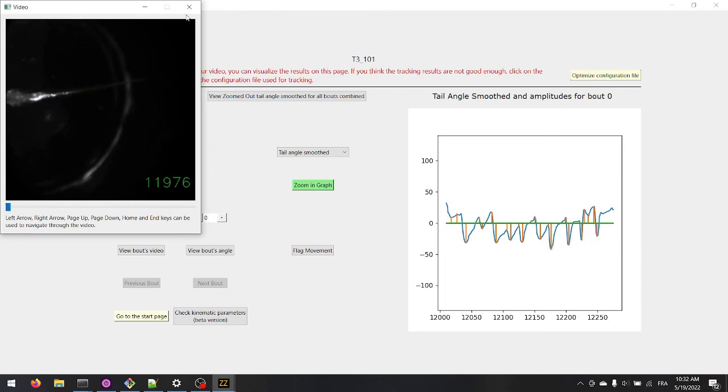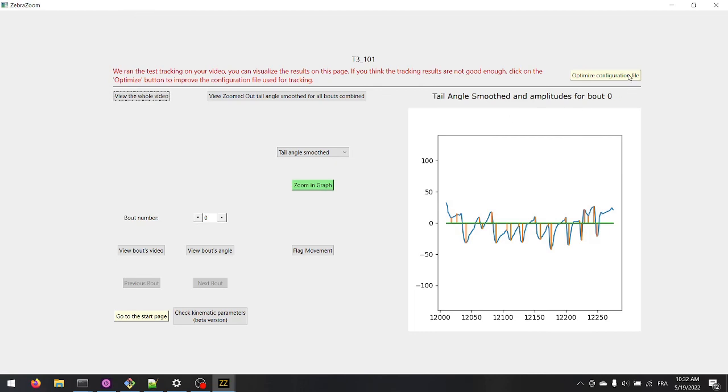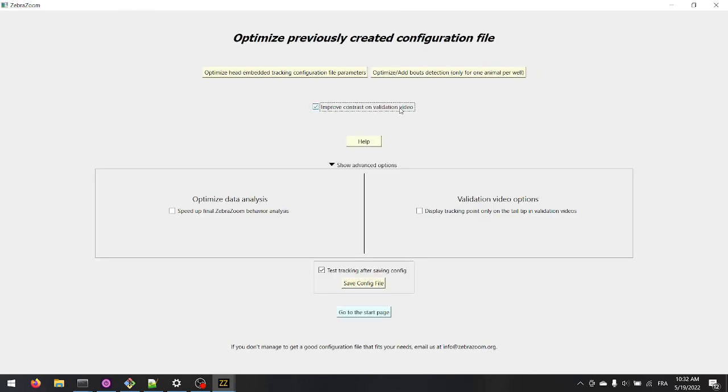Therefore, click on the Optimize Configuration File button. Click on the checkbox to improve the contrast. Save a new configuration file and relaunch the tracking with this optimized configuration file.